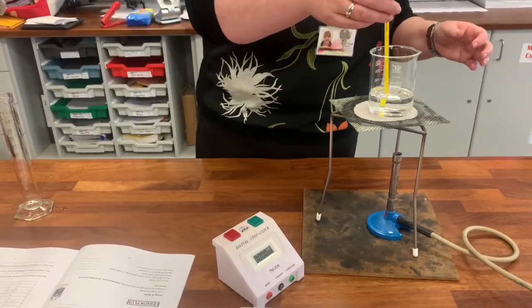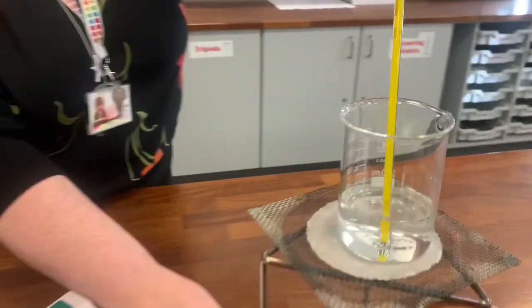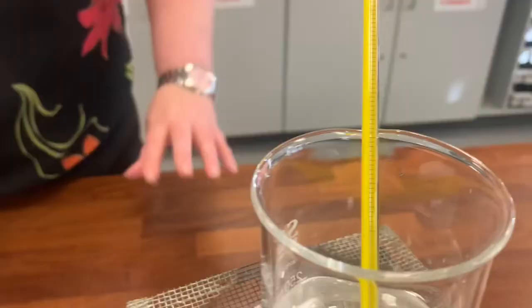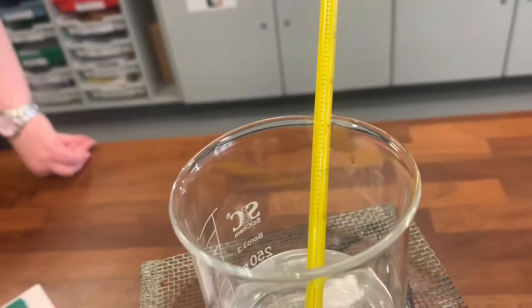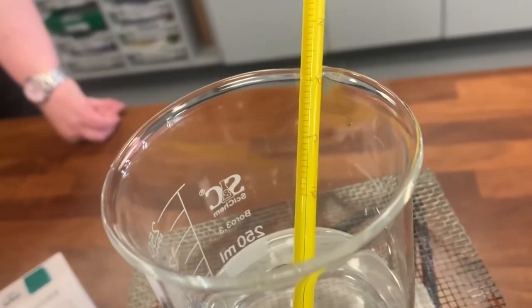Put the thermometer in the beaker and wait a few minutes for it to settle. Here's a top tip: turn your beaker around to put your thermometer in the little pouring dimple, so you'll be able to see what the temperature is on the thermometer. Hopefully that's coming up in the video and you can record the temperature on your results table at time zero.